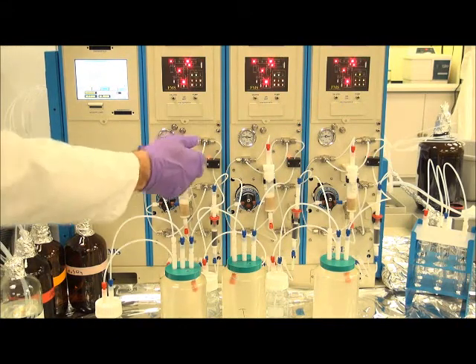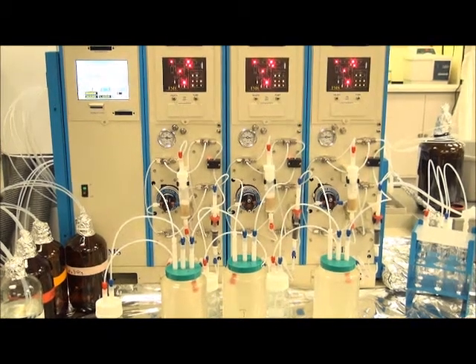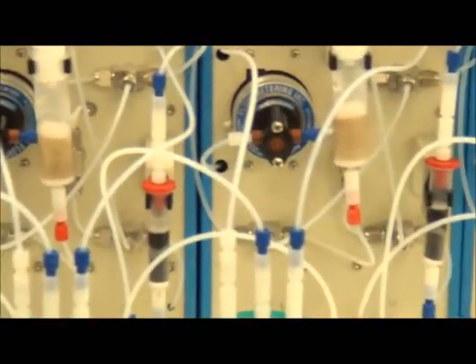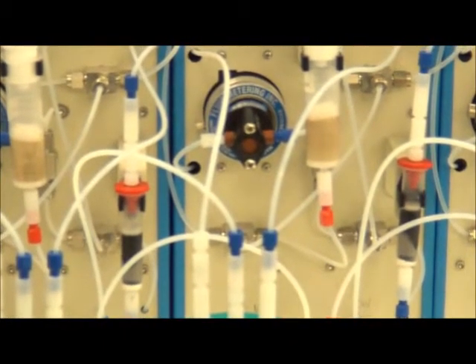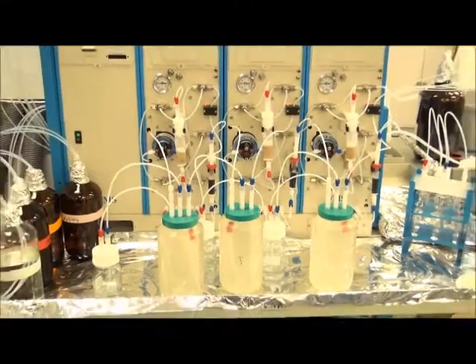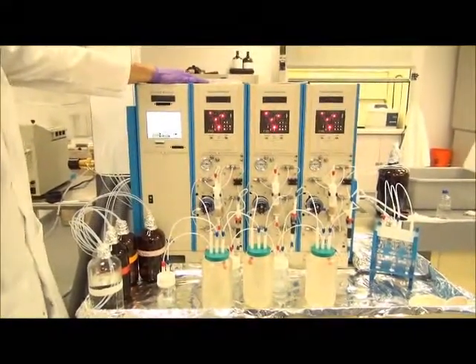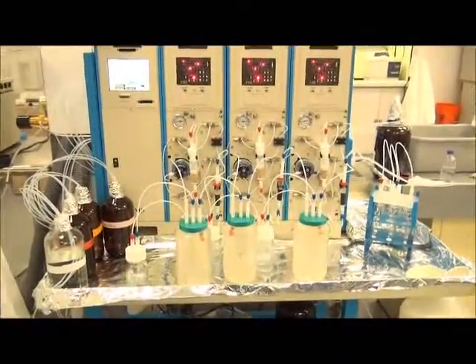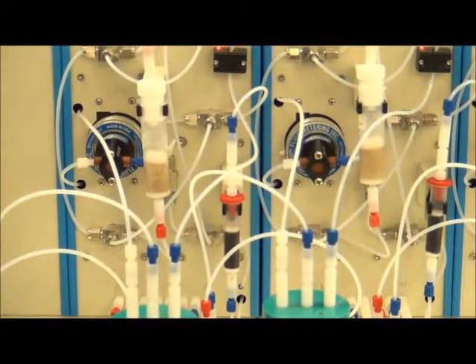We'll now begin to wet the second cartridge with the solvent. Following the cartridge wetting, there will be a brief nitrogen pulse of the cartridges to ensure all the methylene chloride is removed from the cartridges before the remaining conditioning steps continue.